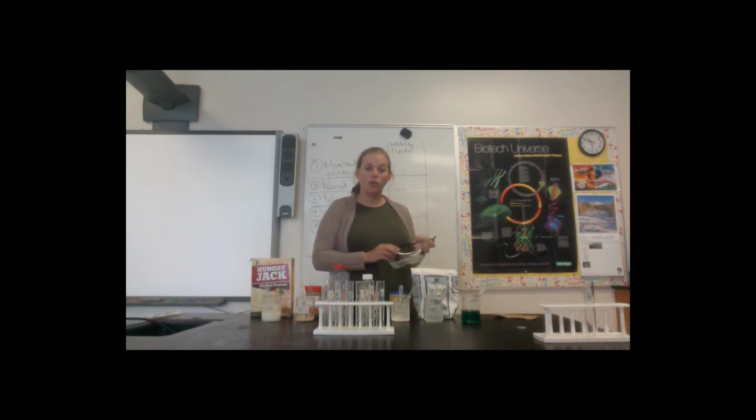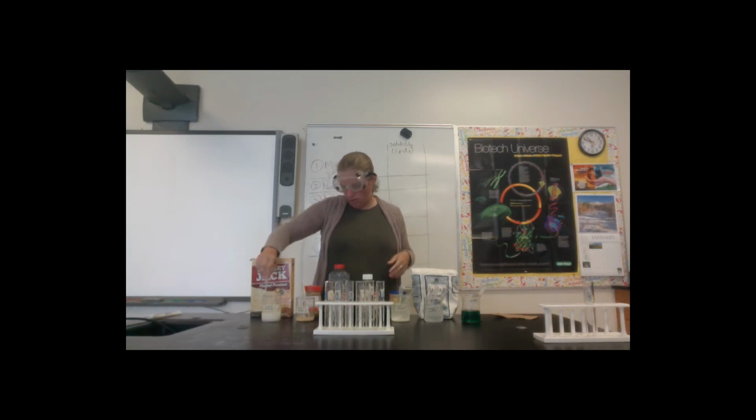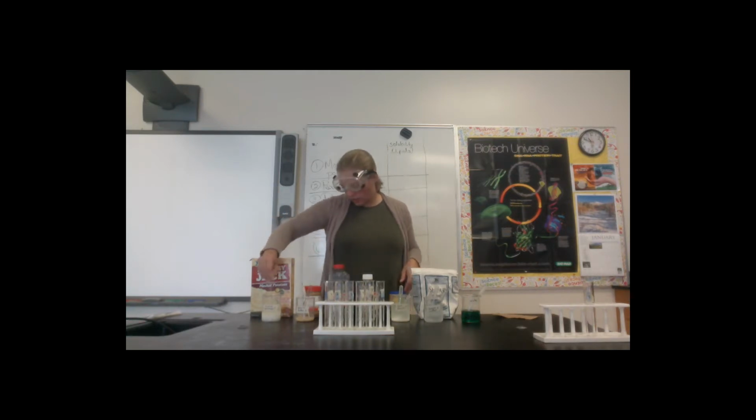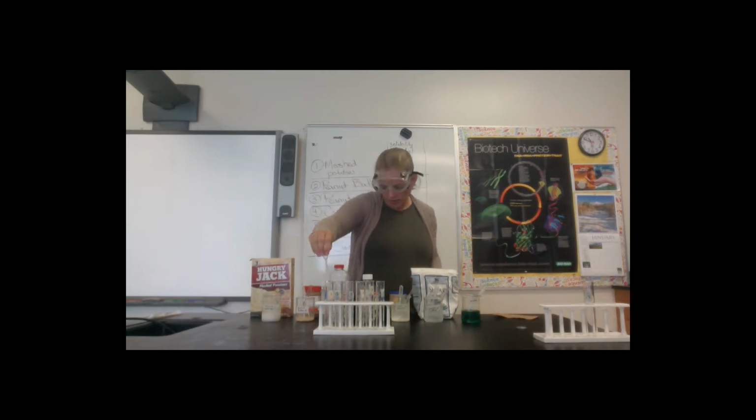So I'm going to set up much in the same way that I did for carbohydrates and proteins by taking 2 pipettes or droppers worth of each solution and putting it into these test tubes, being very careful not to contaminate. Now I really just want to get the liquid part that has the food dissolved into it. As I am filling these different test tubes, I do want you to make your hypothesis. Keep in mind that a hypothesis is an if-then statement. If I test this, then this is what I expect to see. So which of these foods do you think have lipids in them?